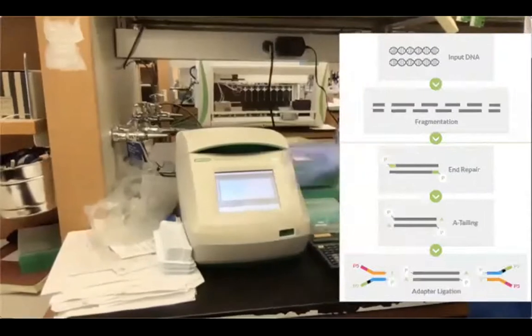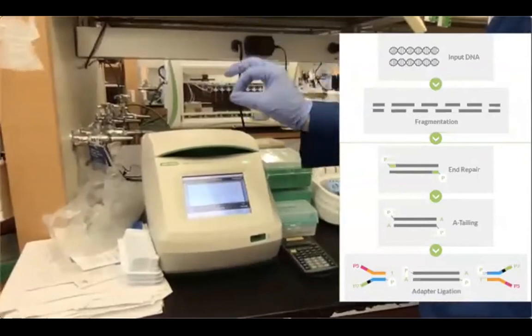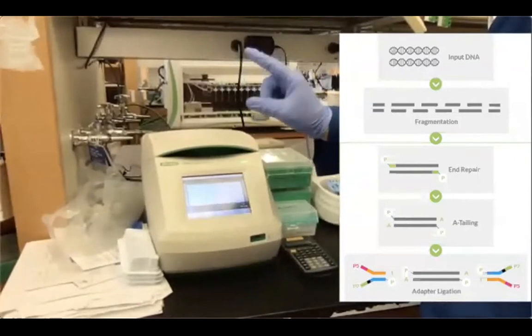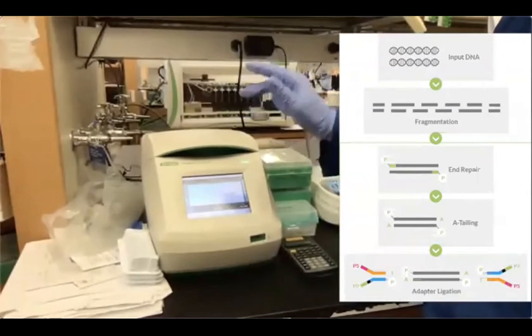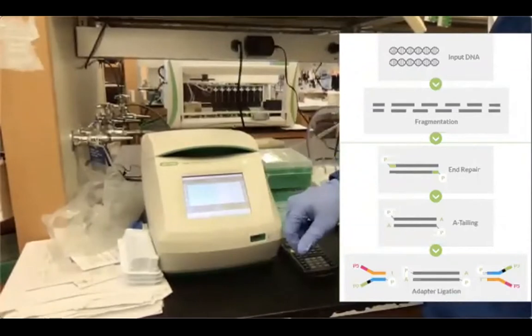Okay, so I just want to recapitulate what we've done so far. We have done fragmentation and polishing and A-tailing at the same time in step 1. Now the entire product without purification, remember these are streamlined protocols, are basically used as input for our ligation. So we've added adapters first, and then the buffer, and then the ligase at the end, mixed everything, spun down, and then put in the thermocycler for 20 minutes at 20 degrees, and then we'll come back with the purification step using the AMPure beads at the end of the ligation.